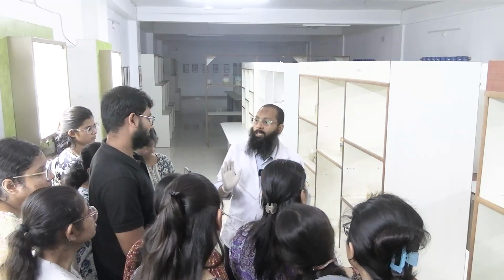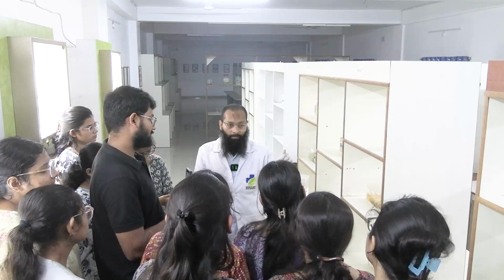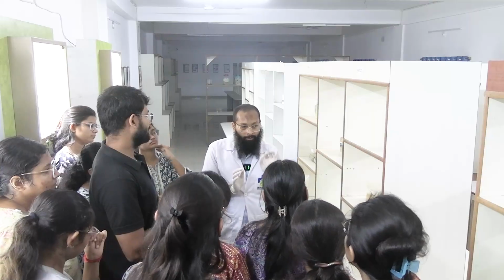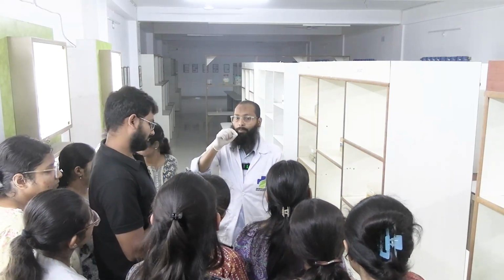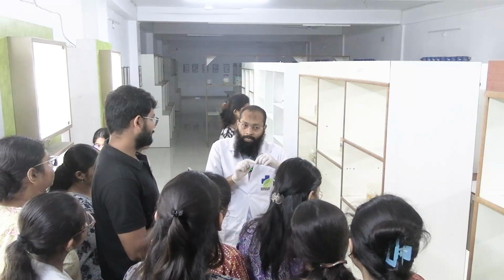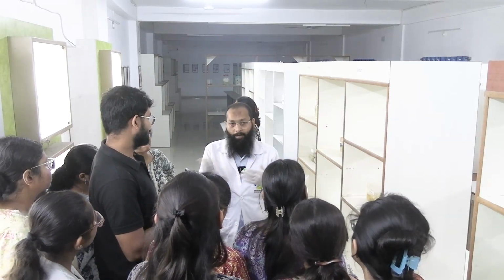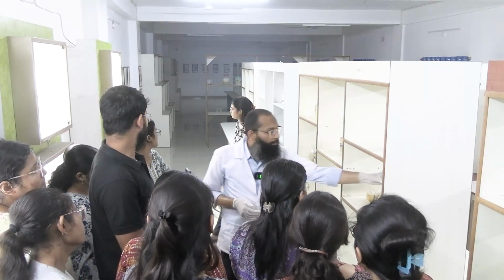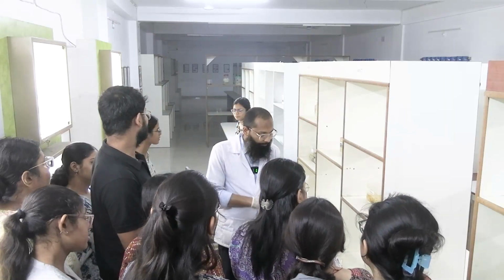Next thing, most of the time when the surgeon sends the specimen, the margins are labeled, like this is the lateral margin, this is the superior margin. Going along with those margins, we can say whether this is the left side or right side breast. But in this specimen you will not get this chance, fine.